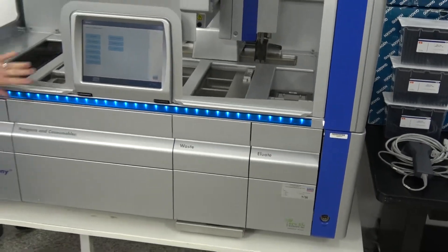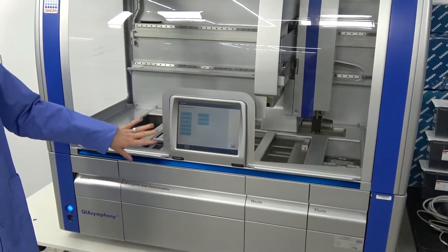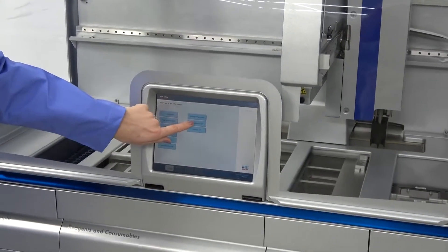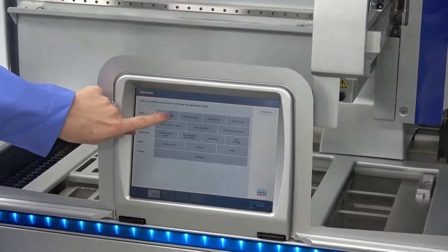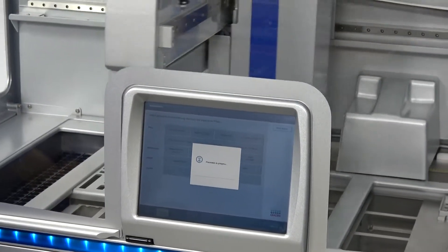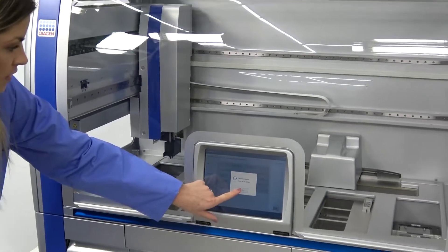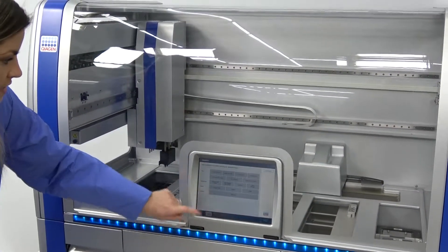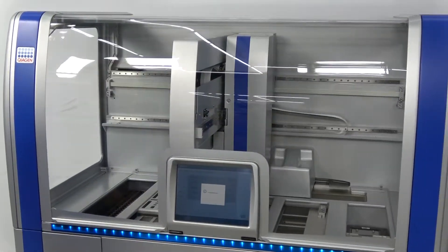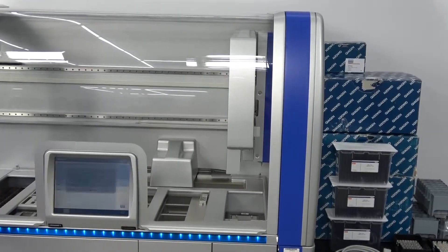The machine is controlled with the touch screen that you see here, and this is where you'll control the functionality of the unit. So if we go into maintenance, I will move the robotic arm so you can see that functionality. This is guided by a laser inside, and it's just telling us that it's done and we will move it back to the right. It's got a really nice smooth movement and it will seat right over there on the right hand side.